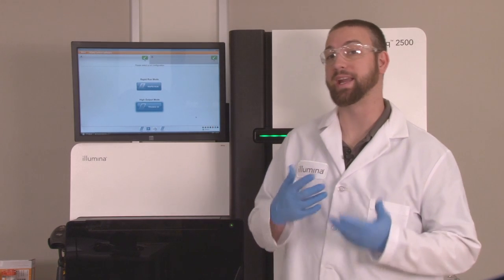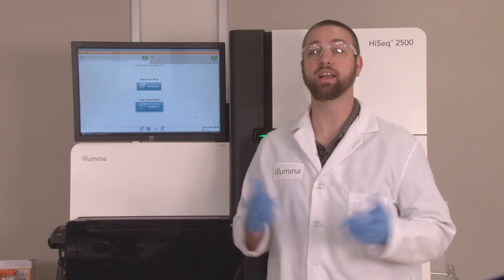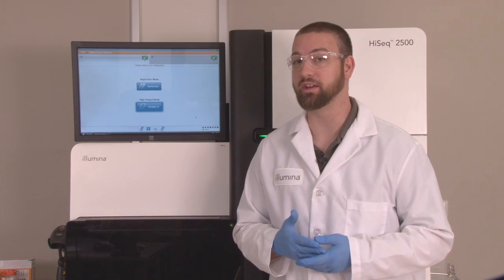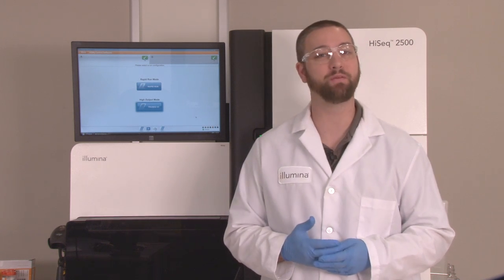This concludes our segment on the mechanical systems, thermal systems, and maintenance for the Hi-Seq. Our next segment in the Hi-Seq video series will cover the tips and tricks for the fluidic system. We'll see you in part four.